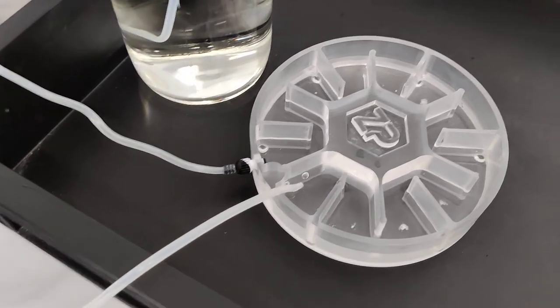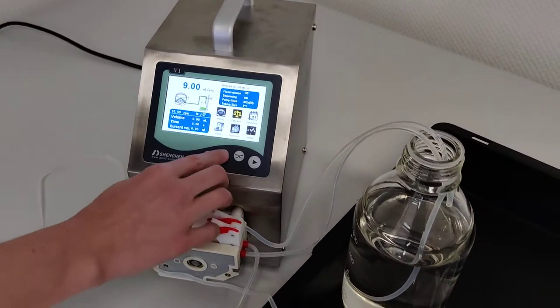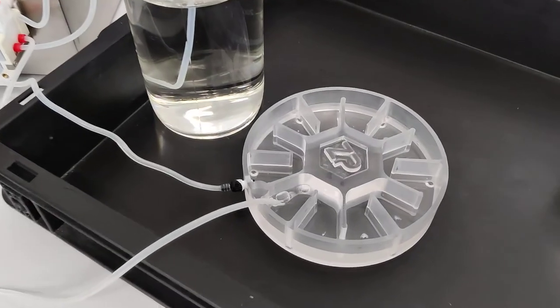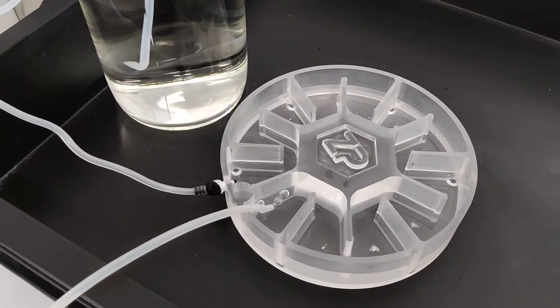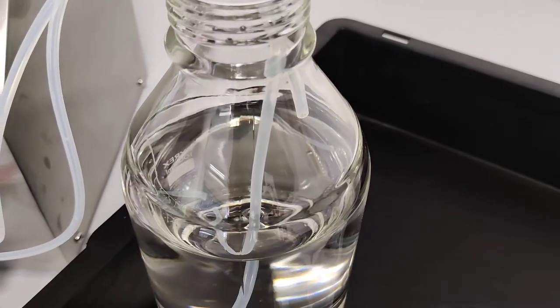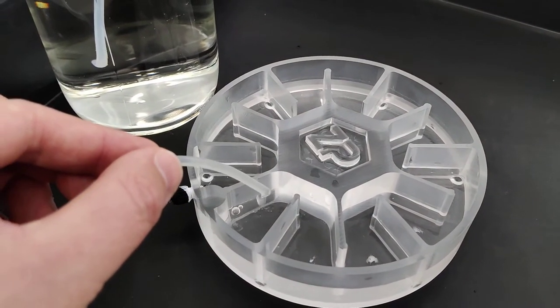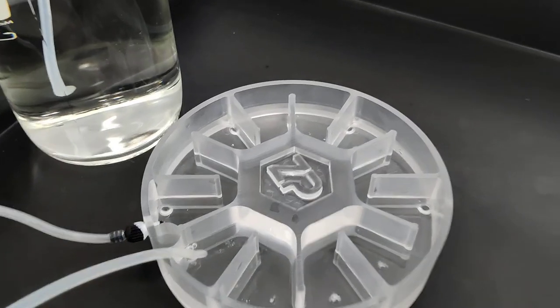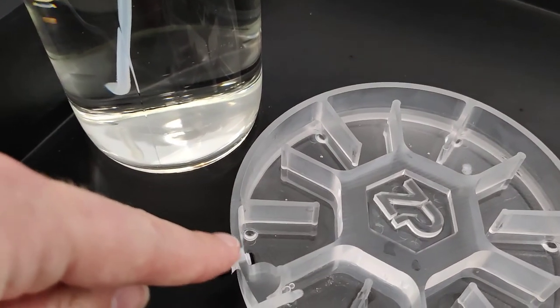So now we can see that the tubings were previously just flushed, so you can see there are some bubbles coming out. If you hold in the speed button, Anna, we will try to get the system to work a little bit faster and hopefully soon these bubbles should vanish and liquid will be coming out instead. I can see no liquid has been pushed yet. And now we see that liquid is starting to come out. So you can see that we are adding liquid and then eventually this liquid will fill up to a certain critical level.